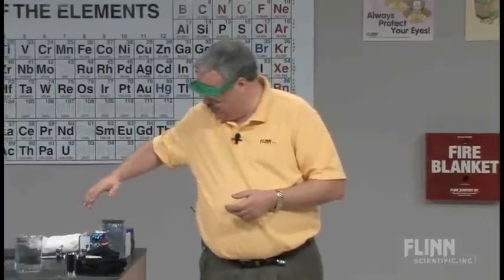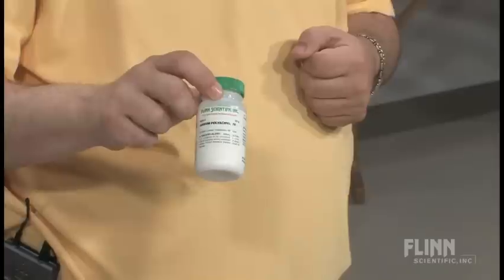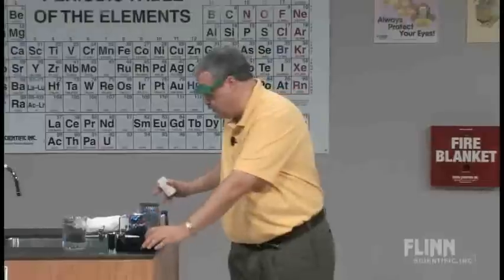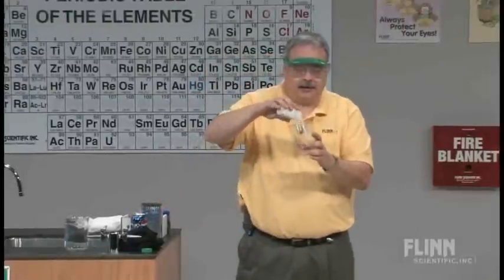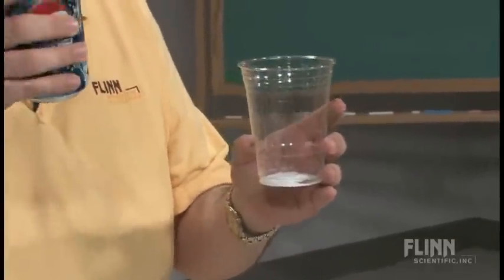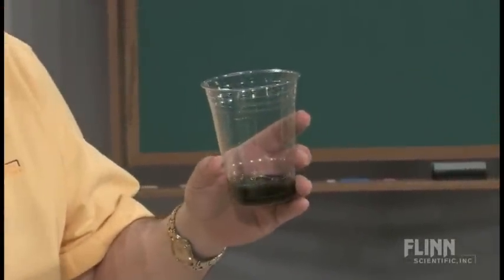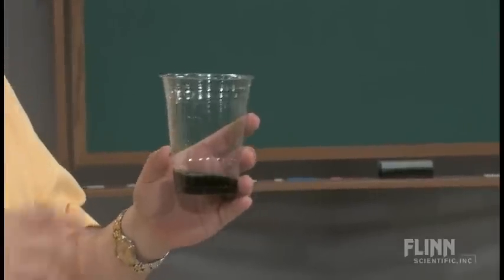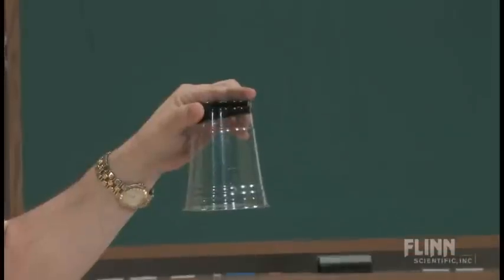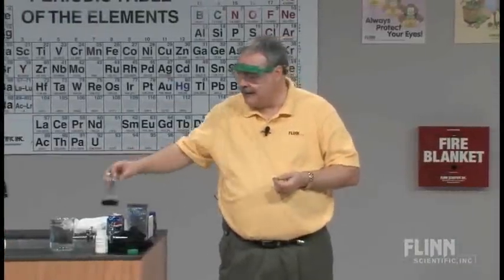What I did is use a substance called sodium polyacrylate. It's snow powder. It does a phenomenal job where you take a little of it, and it's a substance that absorbs up to 800 times its mass in water. And you just pour it in, and what's going to happen is you're going to form a series of hydrogen bonds. And if you look at that, give it long enough, it gels up.